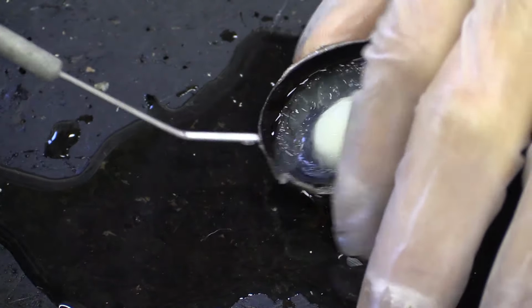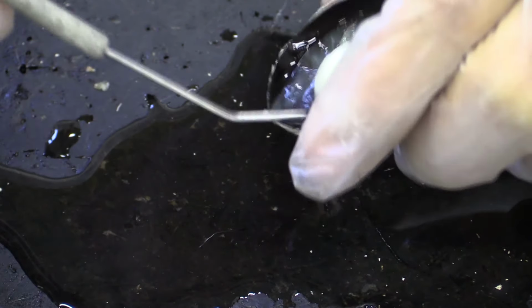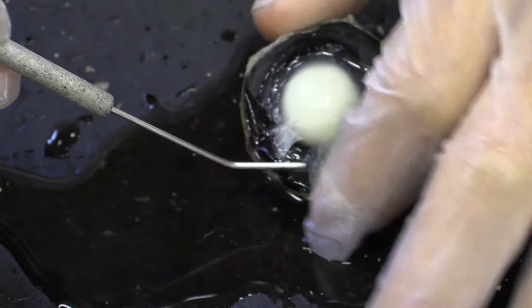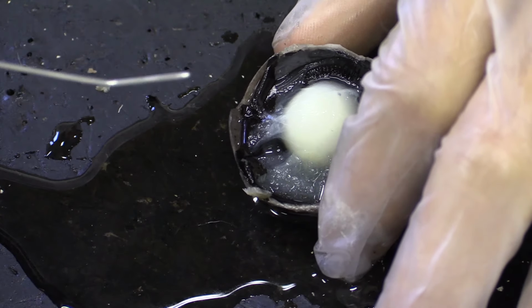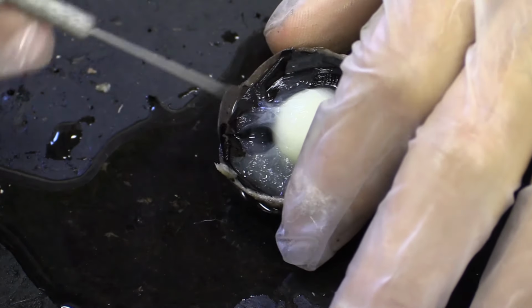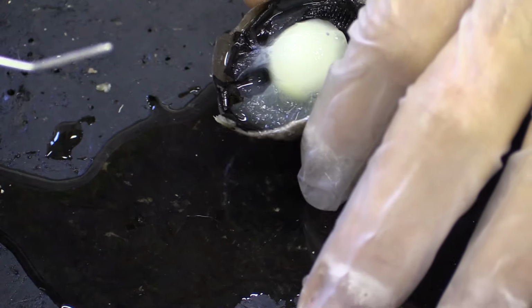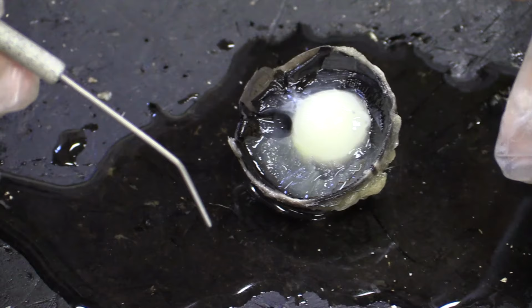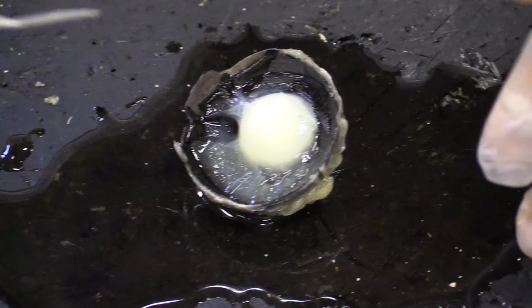So, like before, I'm just going to pour out the excess aqueous humour and some vitreous humour, which is not really that present at the moment. And what is this gumball-like round shape in the middle? Here in the anterior 1/6 is the lens. And the lens is normally crystal clear, like the cornea, but unfortunately the preservatives have denatured the proteins within the lens. The point of the lens is to refract light so that it can be focused onto the retina.